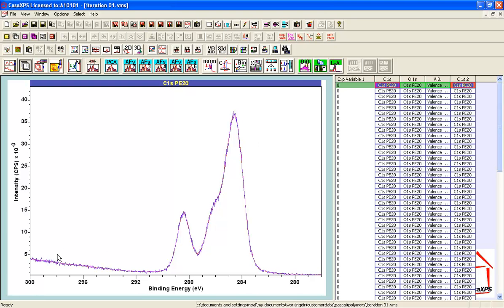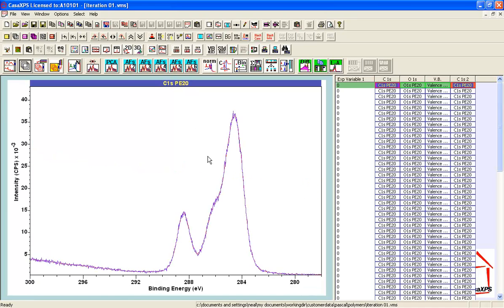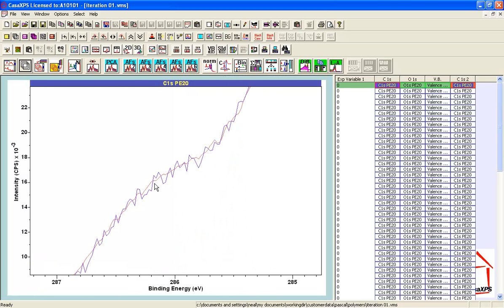And we can see that if I zoom in, it's easier to see that the PCA result has eliminated a significant proportion of noise. This is the background, and we can also see in different parts that the red trace represents the PCA solution, and it certainly has less noise than the original data. Now the reason why I would like less noise in the carbon 1s spectra is because I would like to form difference spectra, and these difference spectra by their definition will be subtracting 2 spectra, and subtraction tends to amplify noise, so the less noise I have in the data, the better this calculation will be.